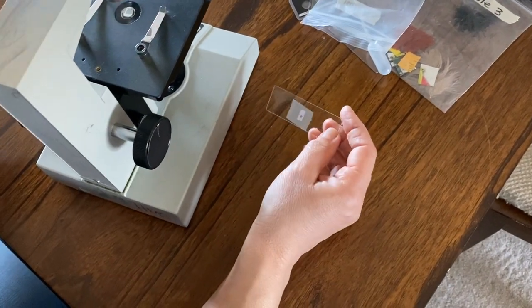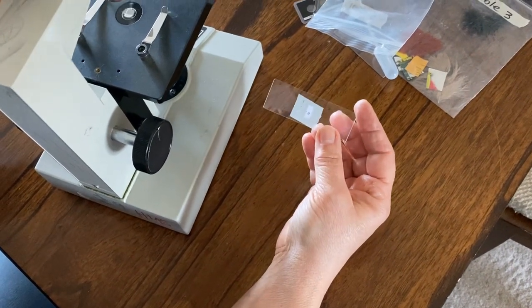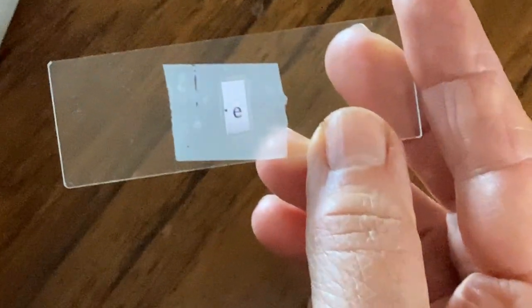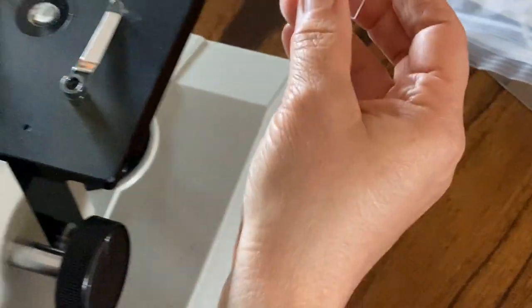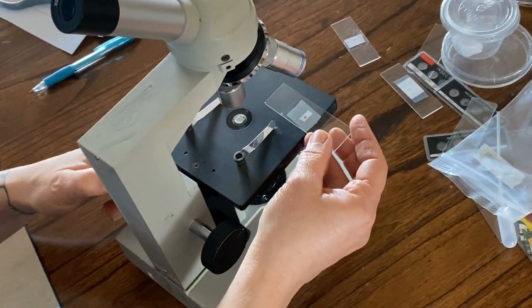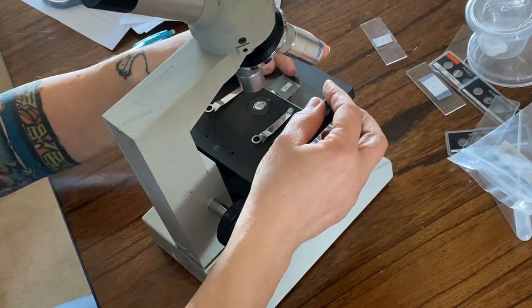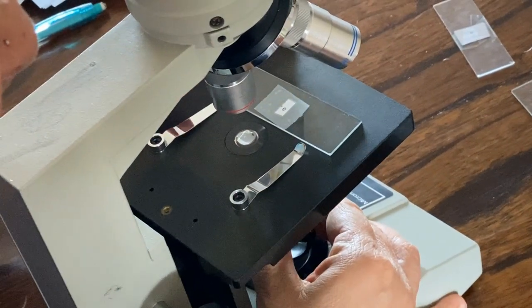Yeah. When you're going to look at something in the microscope and you have your slide, I want you to notice something. Can you tell what that is? Yes? What is it? An E. It's the letter E. So when I put this onto the stage, first of all, you want to make sure the stage is all the way down and the smallest objective lens is over the hole, and you have light coming in through.